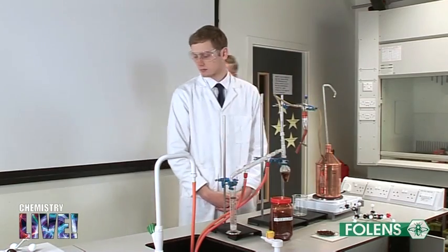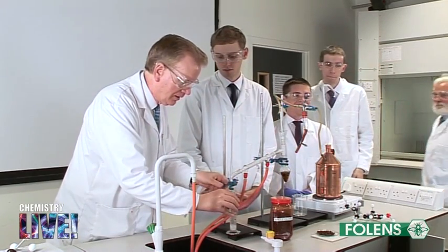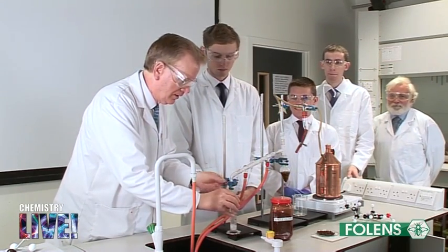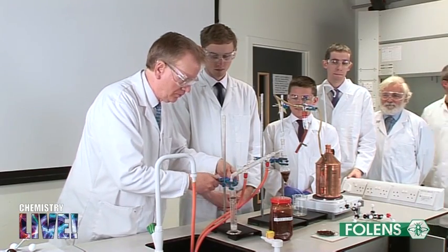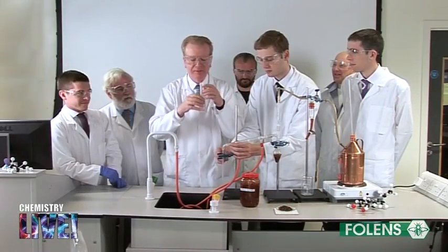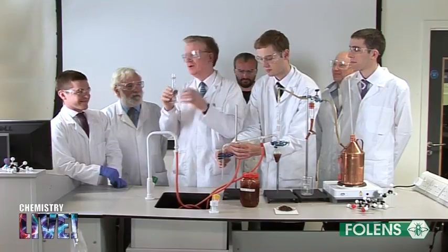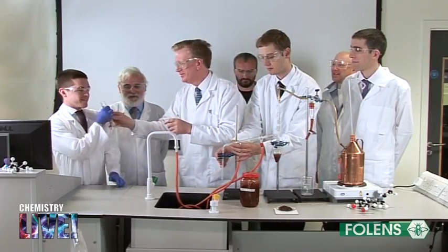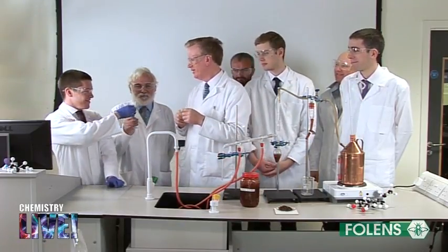We hope that you enjoy this nice smell from the steam distillation. The emulsion has a really nice smell of cloves, and we invite the rest of our team to sample this lovely smell.